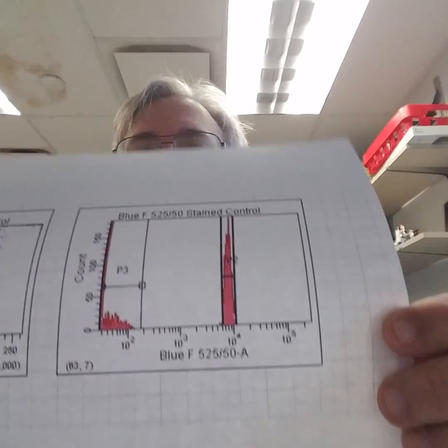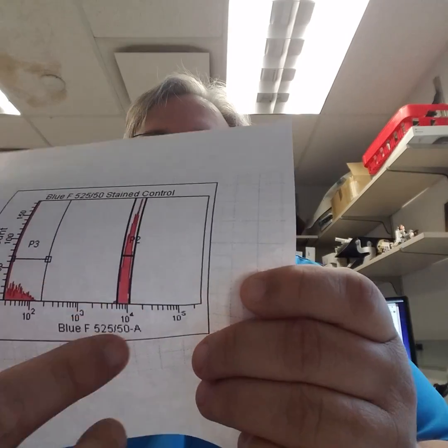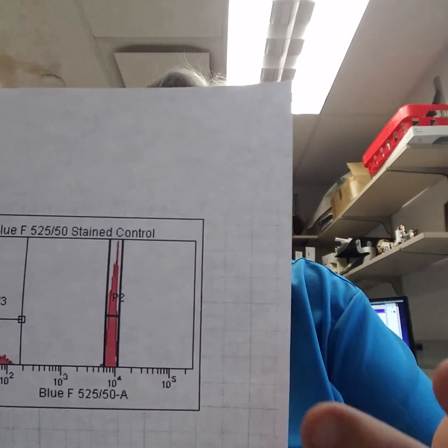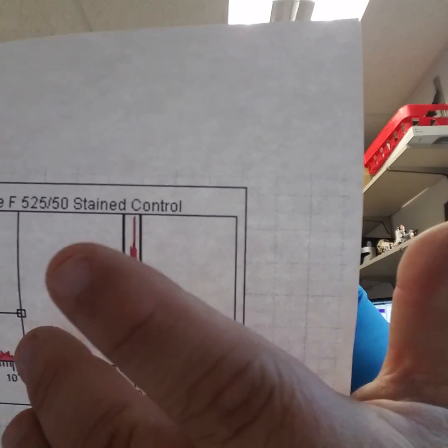Now when you get to compensation, you get this typical window here where you've got your forward and side scatter and then your plot here. The P2, that's the gate generated by DIVA. This P3 is the gate that I generate. I add onto it. By putting that P3 gate on, it tells DIVA to use that as my negative control.